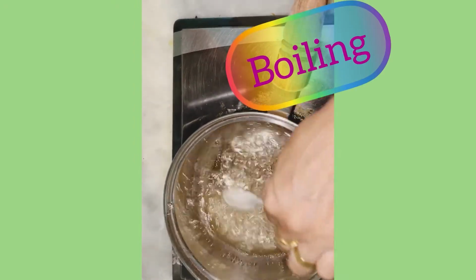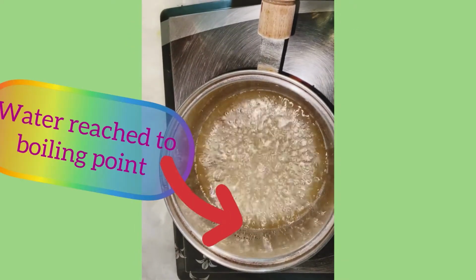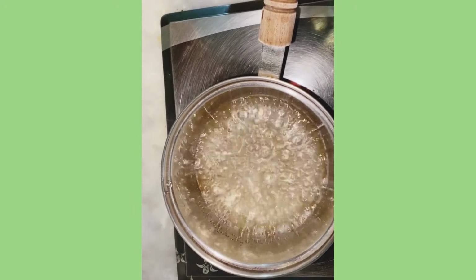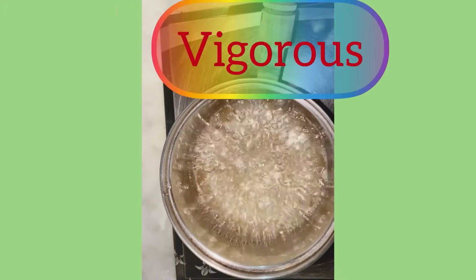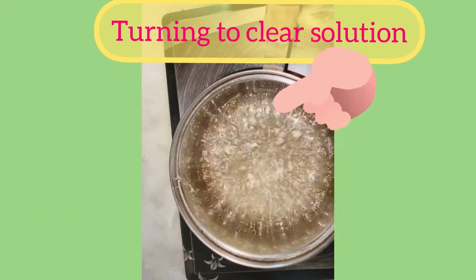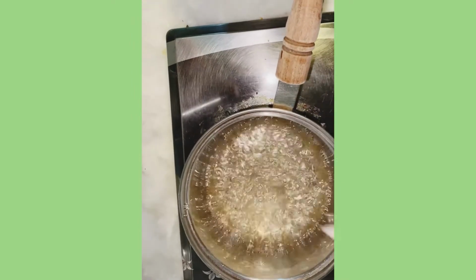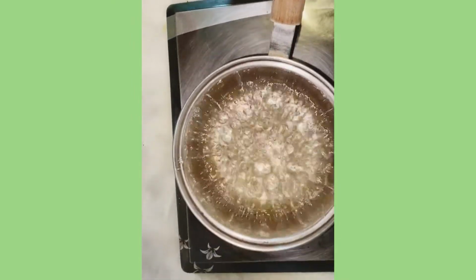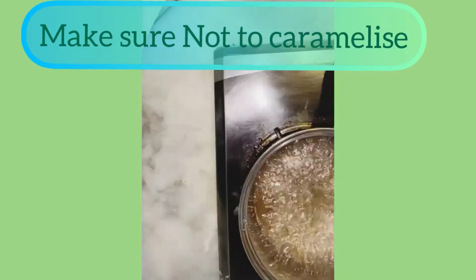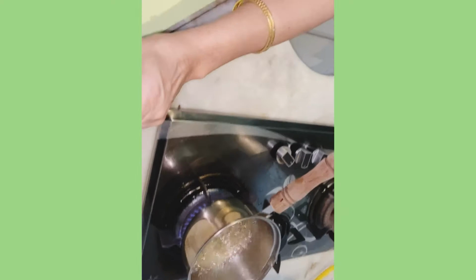It should bubble, and then it will cease down. It's bubbling now, you can see it.